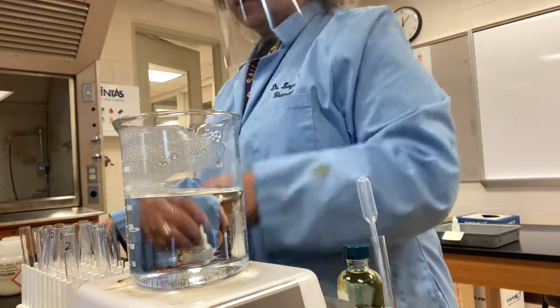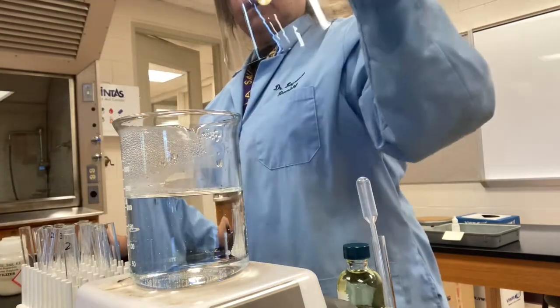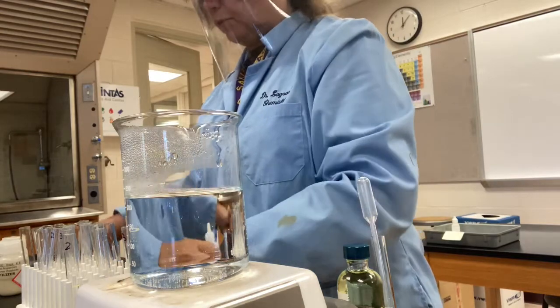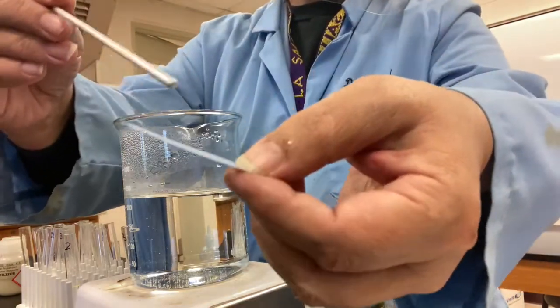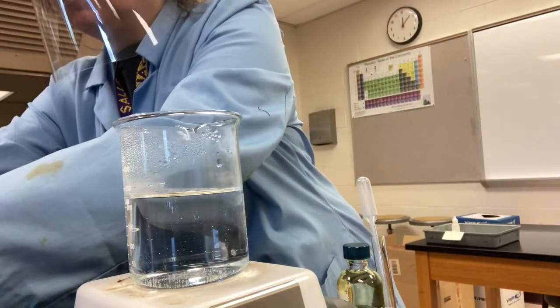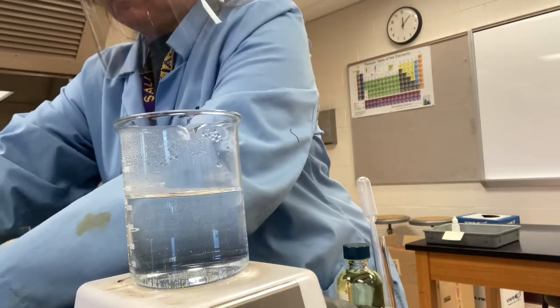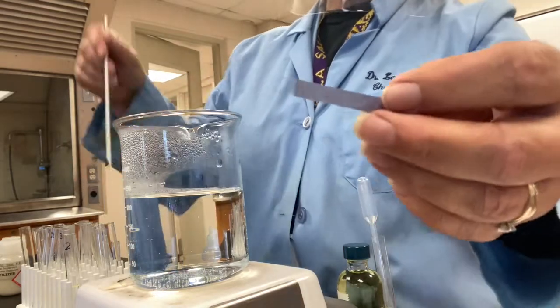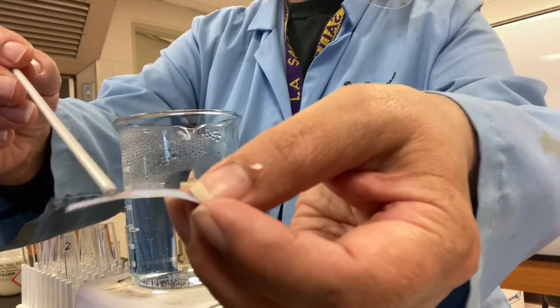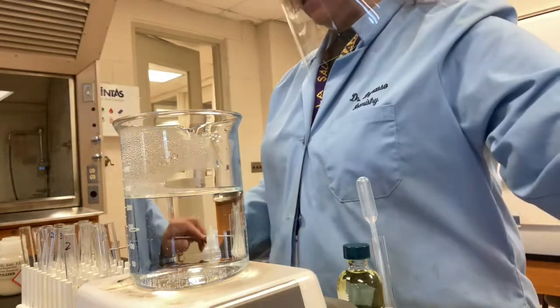Then the last one, the fertilizer. So the fertilizer I'm expecting will not be acidic until I add the nitric acid. So I'll test it. Oh, it is testing acidic. It might be an anomaly. Maybe I didn't get all the nitric rinsed off my testing rod. Let's try that again. It could be acidic because there is ammonium in it, and ammonium, unlike ammonia, is an acid. So indeed, it's already acidic, so I'm not going to add any nitric acid to it.